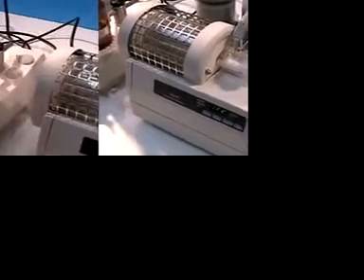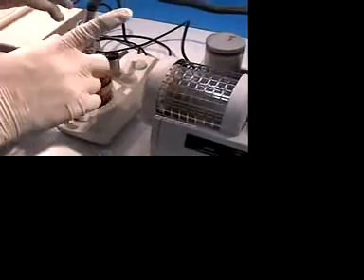Now, we are measuring the moisture. This is your standard vessel. This is where you would do a direct injection into the port if you were using a liquid sample. Here, we have replaced the stopper with the bubbler tube so that the moisture can come into the vessel. In addition, we have our detector electrode and we have our generator electrode.